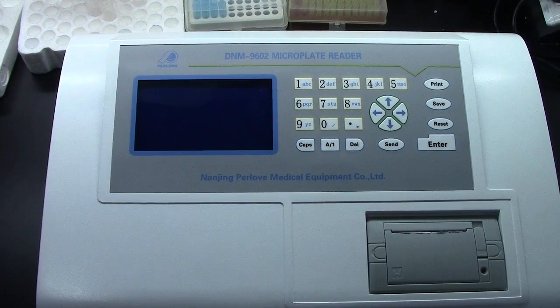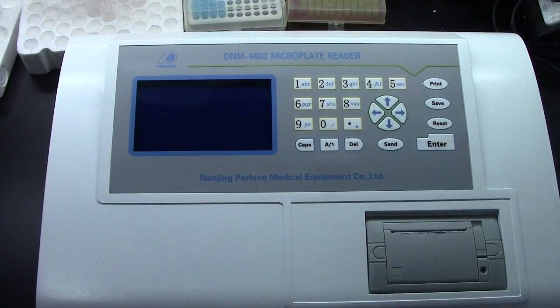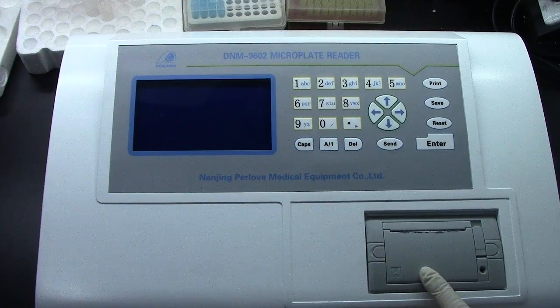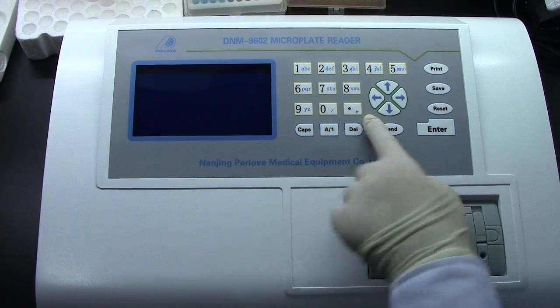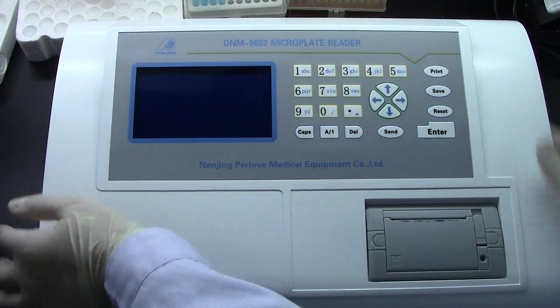Firstly, I will show the main structure of this machine: thermal printer, control panel, LCD display.